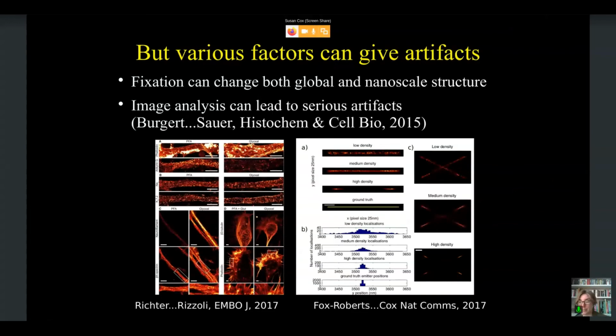when you have an artifact, when you have an inaccuracy, you're not necessarily getting further away from the ground truth position. So if we look at the high density images, either of the line or the cross, the parts of the image that are present are actually closer to the ground truth structure in this case, because we have a line, and when you have multiple things on a line, you tend to bias your fits towards the mutual center of overlapping things. And if you have a line, that mutual center is along the line. So the structure which is present is closer to the ground truth structure, but you have a lot of missing structure and your fits aren't actually accurate. So if we had, for example, a double line structure, we would lose that completely, while in the low density, we would still get something that reflected the size of the sample, even if we couldn't see the structure.